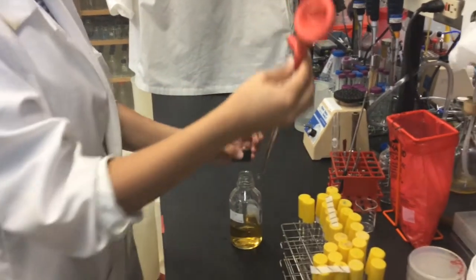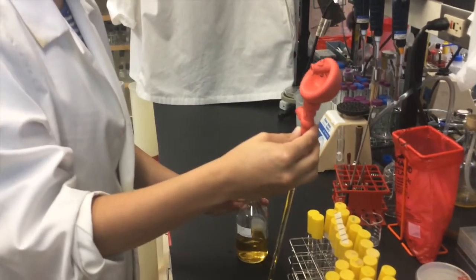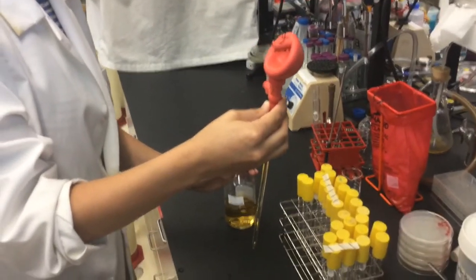Remember to return the cap to the container using your left hand, remembering not to set down the pipette.